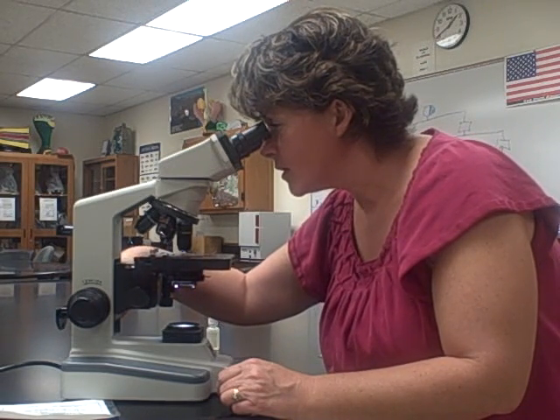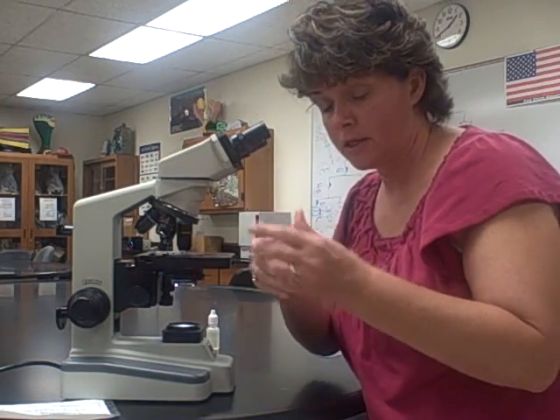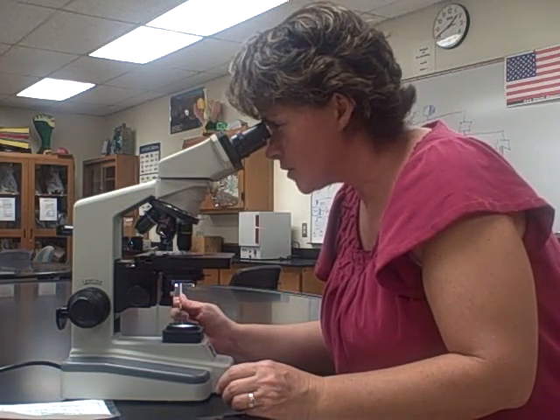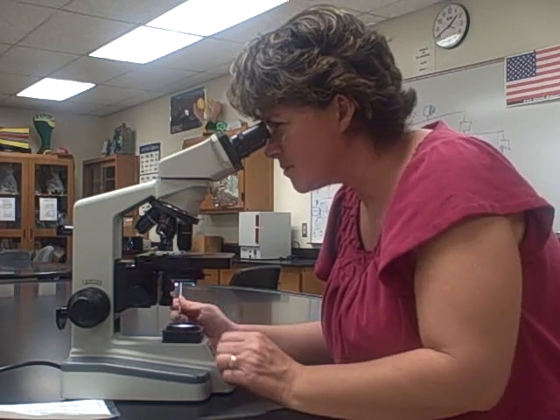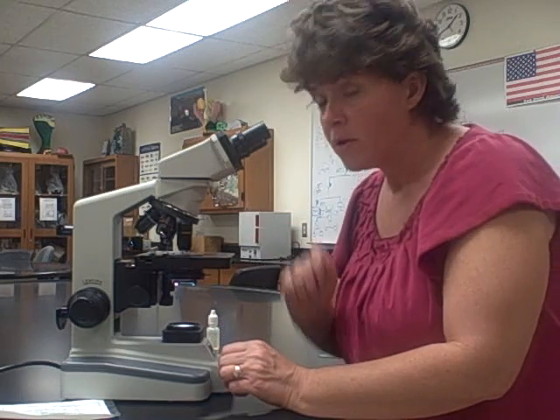The procedure I prefer is that you find your specimen under 10x power and focus. Then you take the inoculating loop and hold it over the light source. As you look through the microscope, look for the loop, and if it's blurry, move the condenser until the loop itself comes into focus. When you go to use higher power like the 40x or 100x objective, it should be in focus with only minor adjustments needed using the fine focus knob.